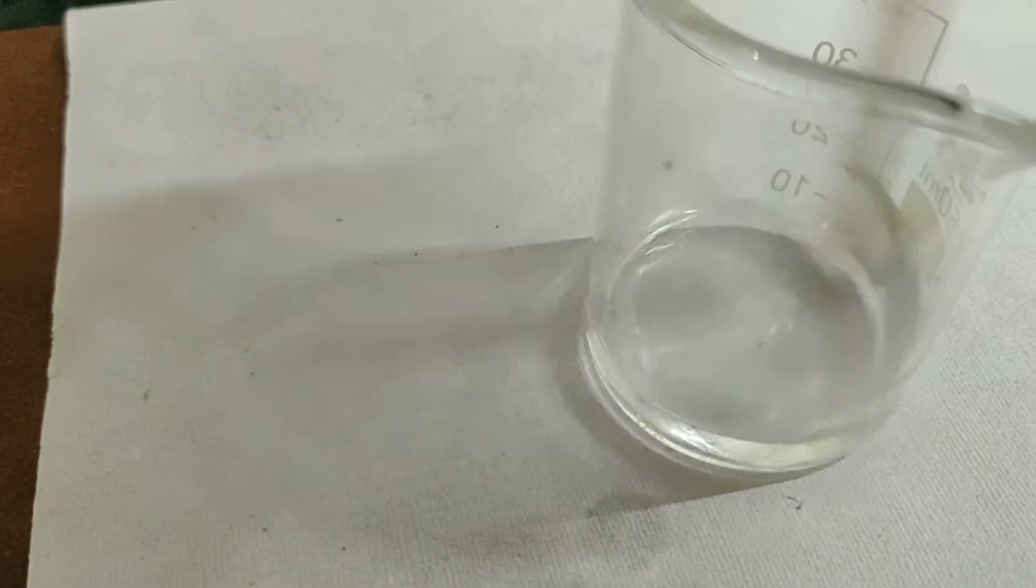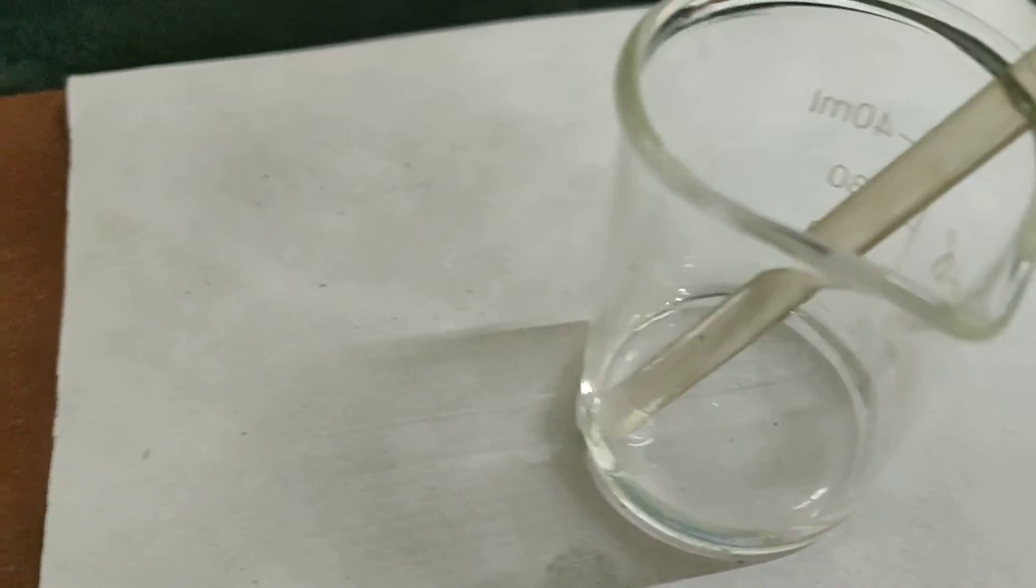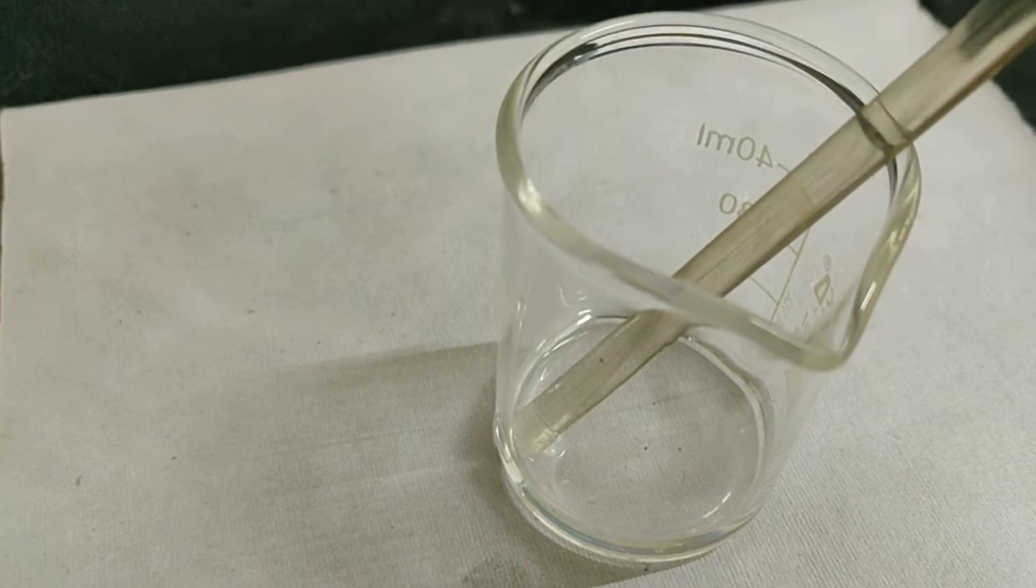To this I am supposed to add concentrated HCl, which I shall add, and then I am going to add thiourea. I have added concentrated HCl and thiourea here. Now I am going to stir it.